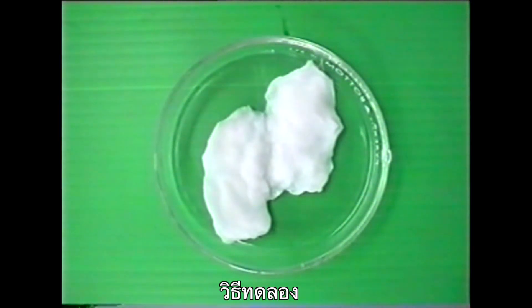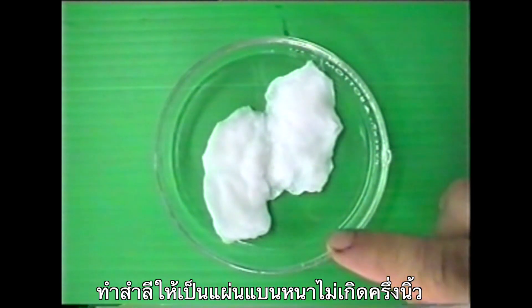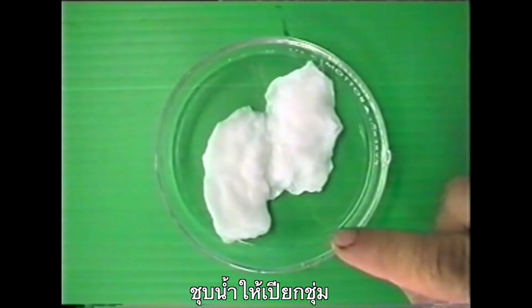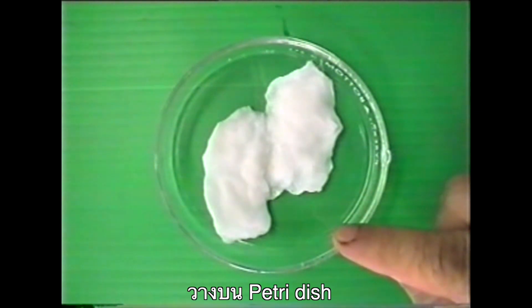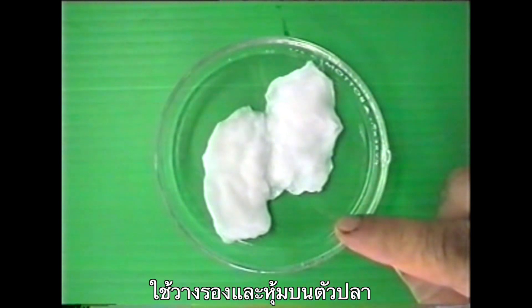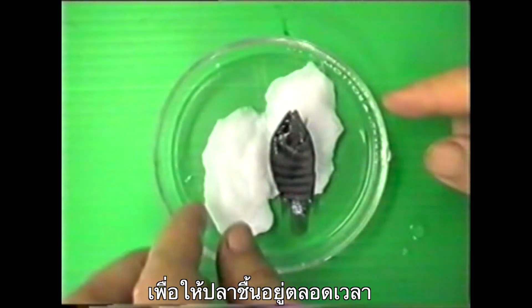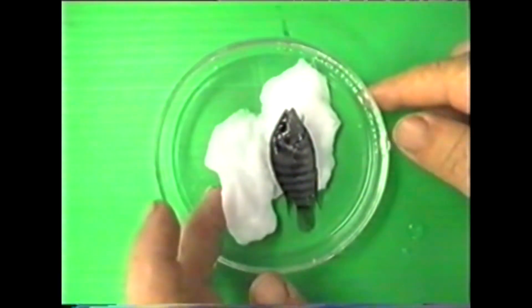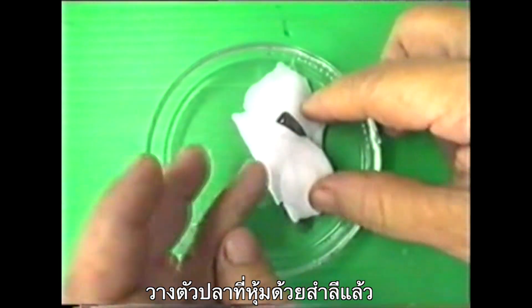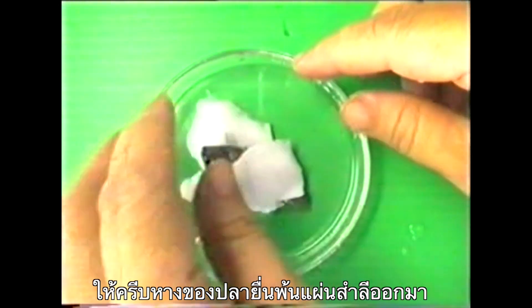Let's start our lab. Obtain two thin cotton wads. Soak the cotton wads in water and spread them on a Petri dish. The cotton will be used to cover the fish and keep the fish wet throughout the experiment. Place the fish in the Petri dish with its head and body lying on the wet cotton.